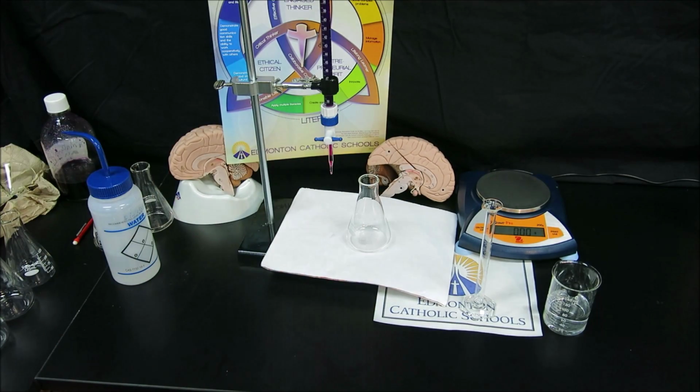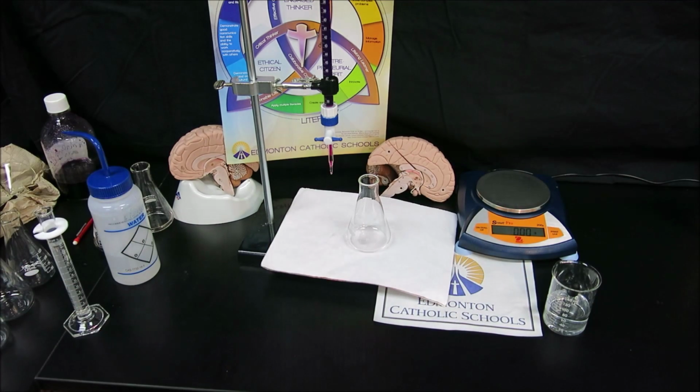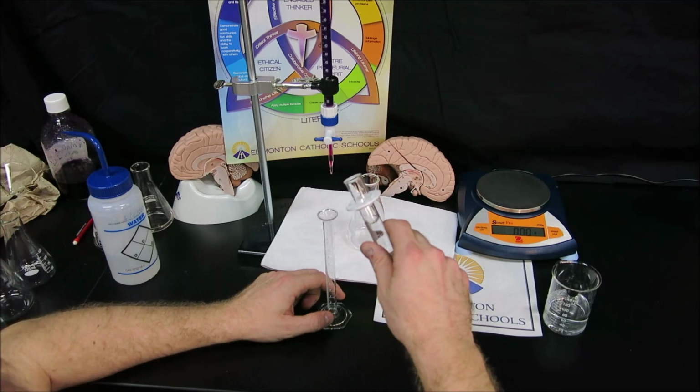Now we need to prepare our sample for our peroxide. Now our peroxide requires acidification. The peroxide does not react with the permanganate unless the permanganate is acidified. However, we cannot acidify the permanganate because once the permanganate is acidified, it is such a strong oxidizing agent, it will in fact react with the water that's part of its own solution. So we can't allow that to happen.